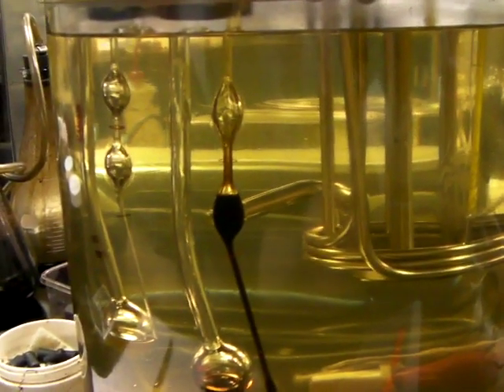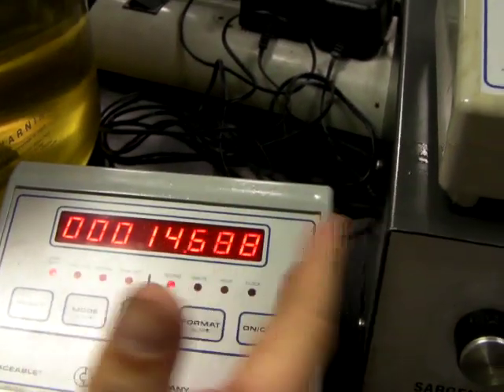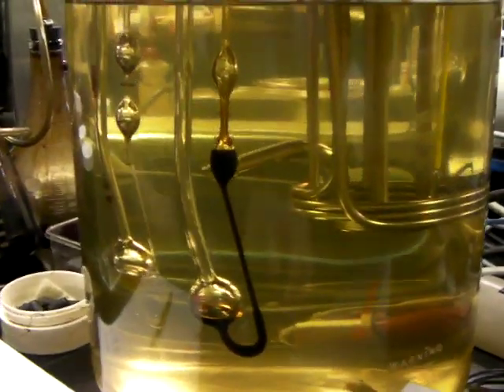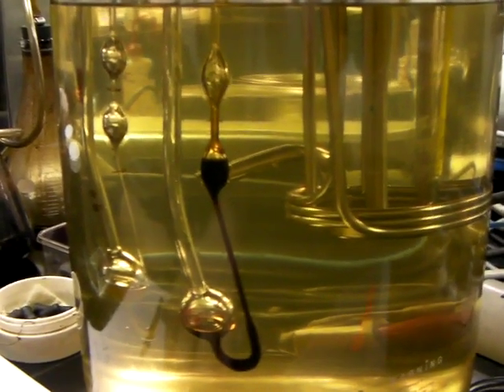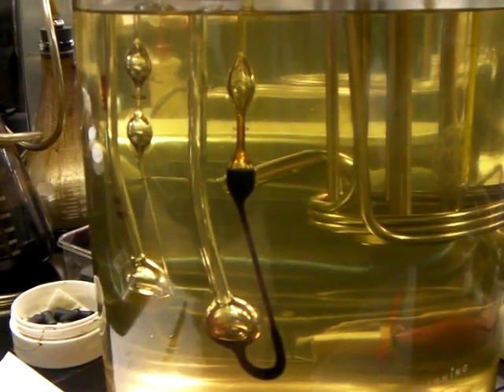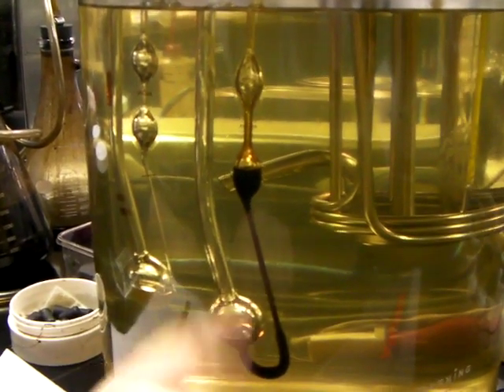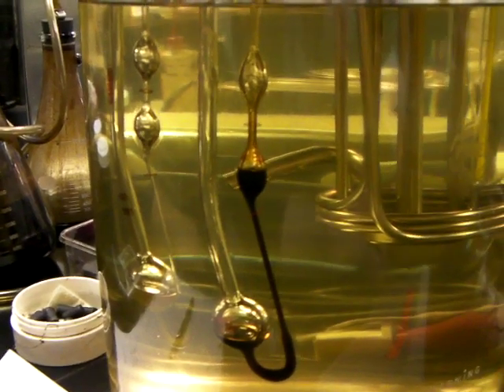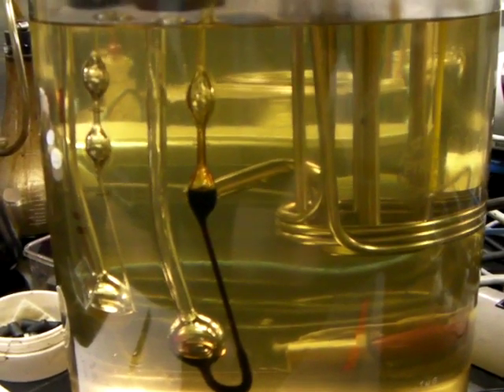And then whatever the time is — taking down here or taking up — seconds, and you multiply the seconds by the factor that was when this viscosity tube was calibrated. They calculated that. And that gives you the viscosity in centistokes.